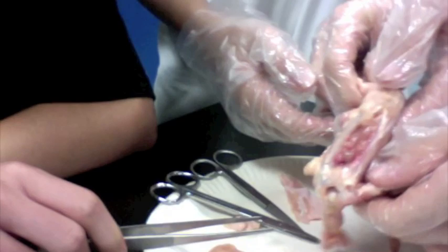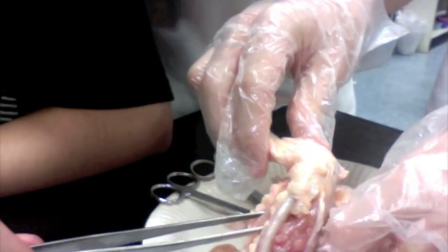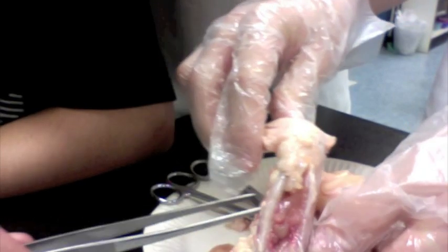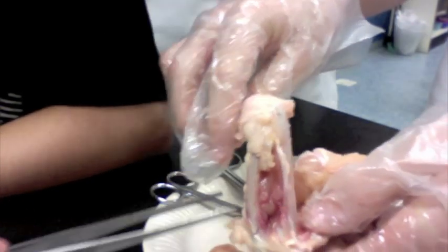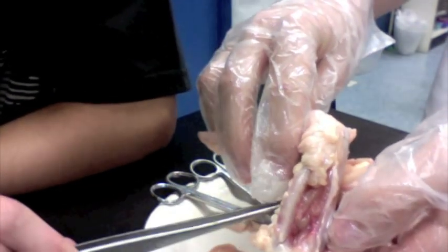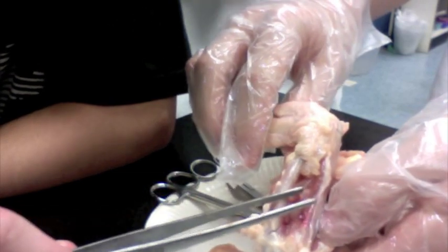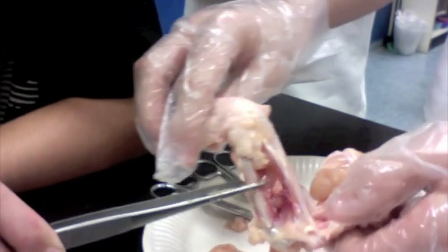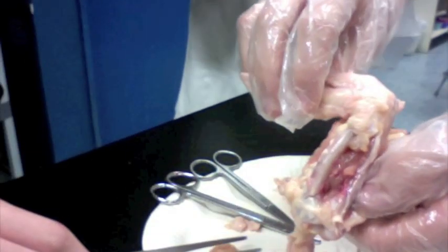This is our bone. Basically, muscles can only contract and relax. So when one muscle contracts, its opposite muscle relaxes. It'll move in one direction, and then the opposite will happen — and vice versa.